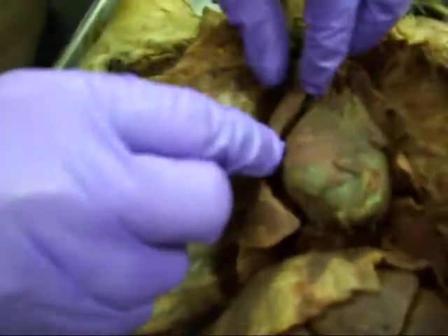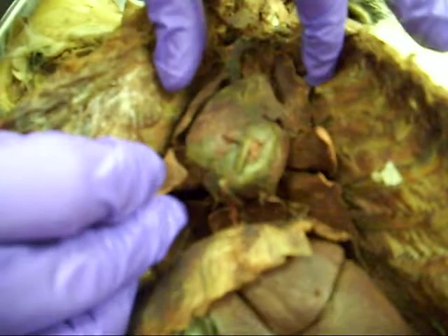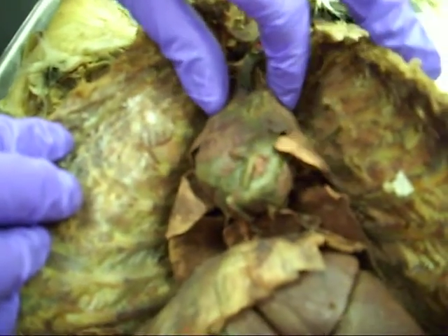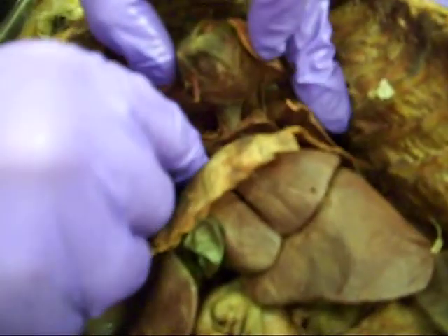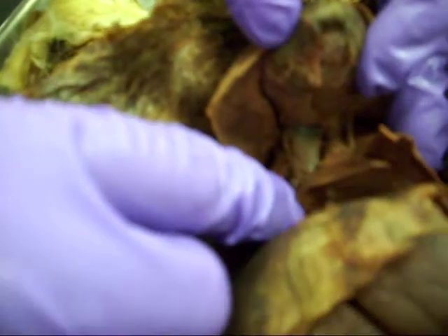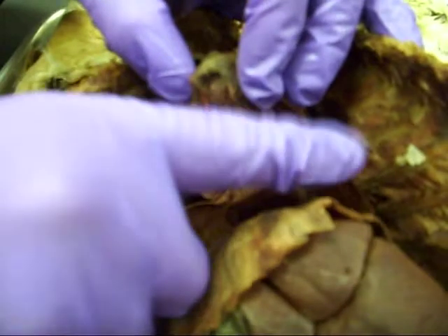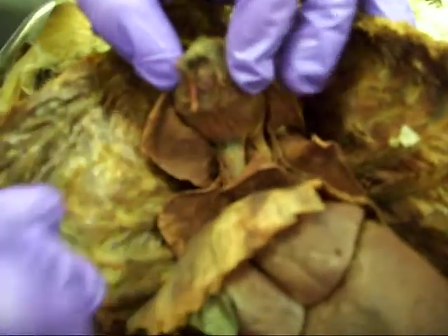Down here, as you come through, you have the lungs — in a live cat these are really inflated. But in this cat, what we have is the anterior lungs, the middle, and the posterior. It looks like the left side has two posterior lungs, but you'll want to look that up in your book.